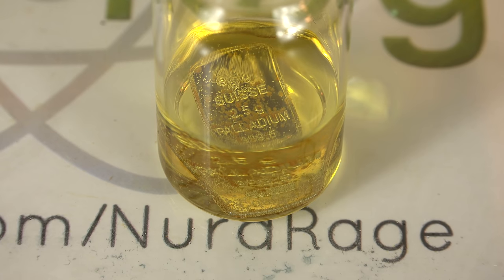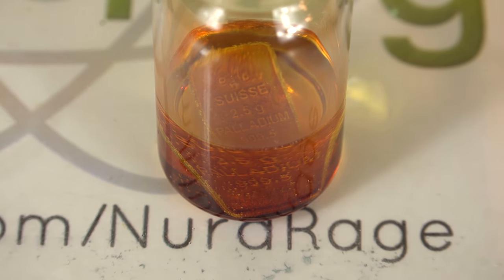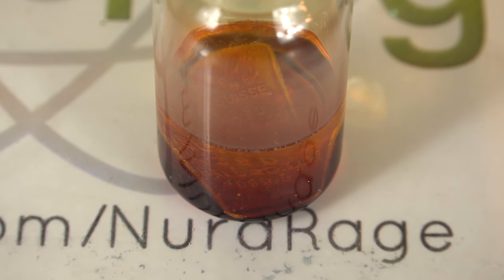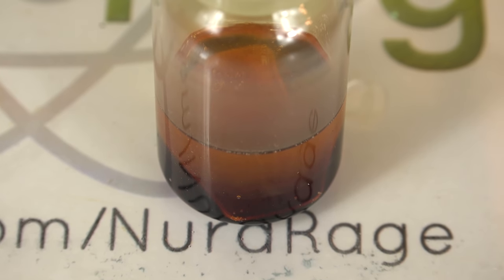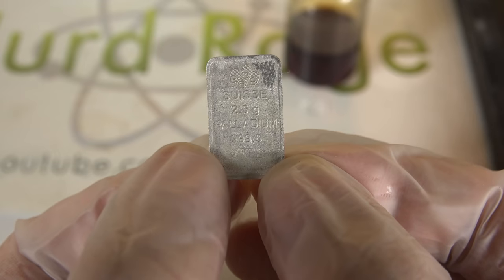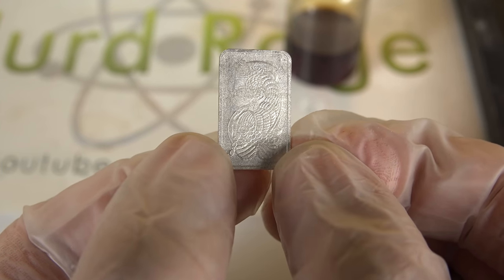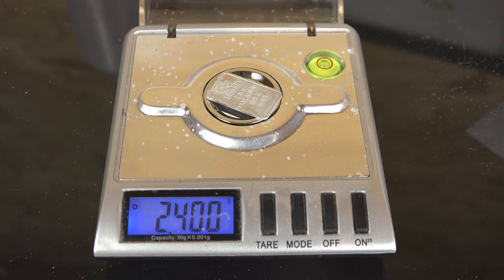So now let's try nitric acid. I'm adding in concentrated 67% nitric acid that I made myself. From what I read it should react but I'm not sure how fast. And wow, that is actually a lot faster than I expected. I thought it would be slow being a precious metal, and while it is much slower than base metals like copper, this is still very quick. It's only been a few minutes and I'm clearly seeing the metal dissolving and the features getting destroyed. What's happening is the palladium metal is reacting with nitric acid to produce palladium nitrate and nitrogen dioxide gas. I actually don't want this to completely dissolve since I have a few more plans for the solid metal, so I'm going to stop it now and take it out at just 5 minutes. And here it is after I dumped it out and washed it with water. It's definitely dissolved quite a bit — the features are still present but have suffered a lot of damage. I was going to test aqua regia but if nitric acid alone can dissolve it this quickly there is no point. Clearly we're well beyond the error of the scale and have certainly dissolved 112mg of mass in just 5 minutes.